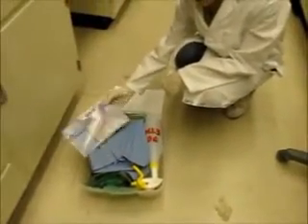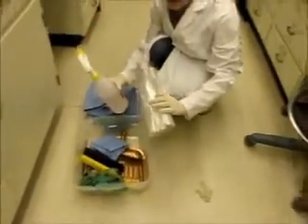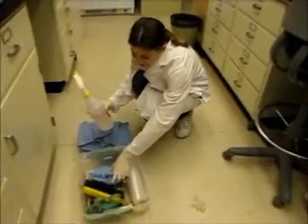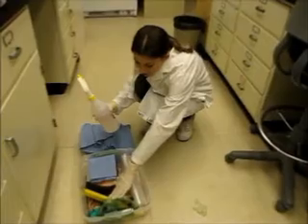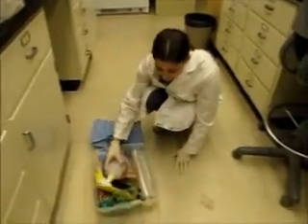And also sterile nitrile gloves, a lab coat, ethanol, bags to put the biological spill in, a dust pan, a dust brush, paper towels, goggles, more gloves, and a giant pair of tweezers. Okay, how are you going to clean this up?